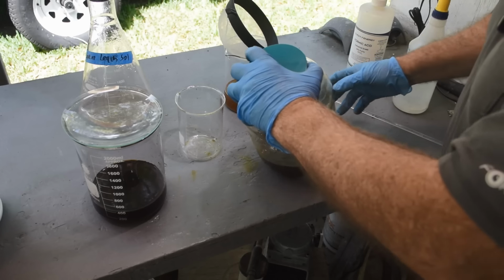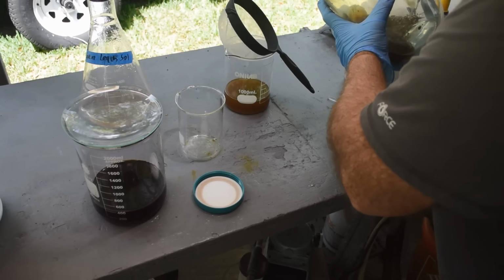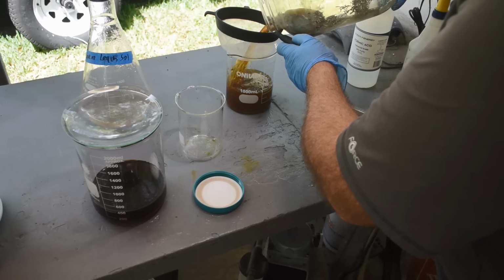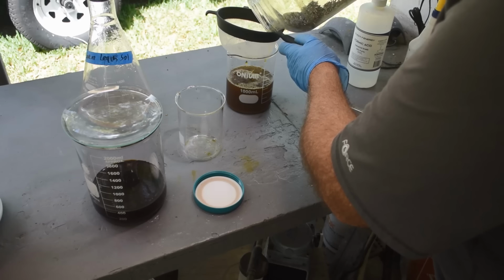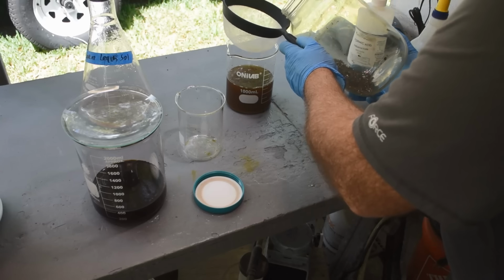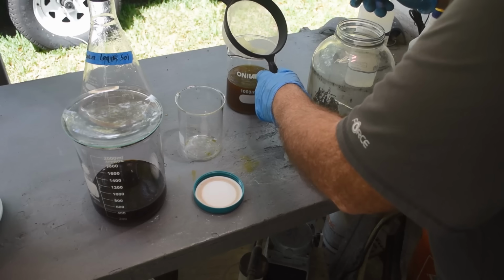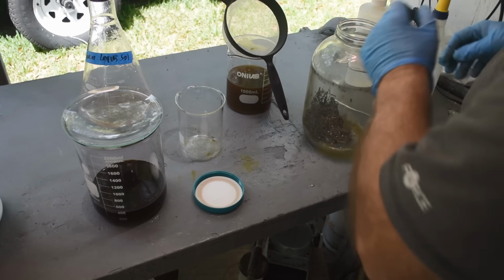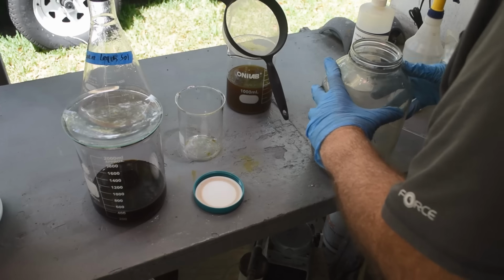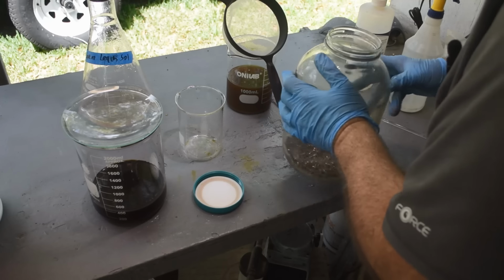All right, this has been on for another 15 minutes. Let's dump it out. And to use this sieve, getting a little smarter in my old age, to get more of the liquid off, and if any pins come over, I can catch them in it. Actually, don't think any pins came over. One or two. Okay. Back in there, you. All right. Well, it's looking a lot better. I still see a little bit of gold in there, in spots, but that's looking a lot better.